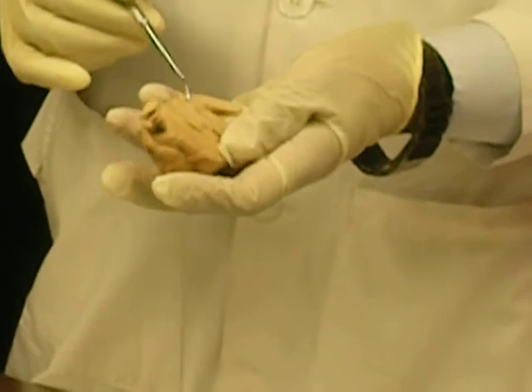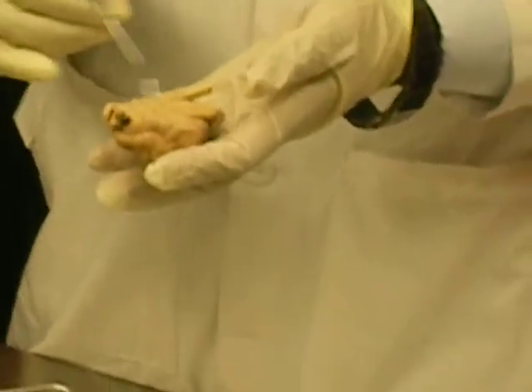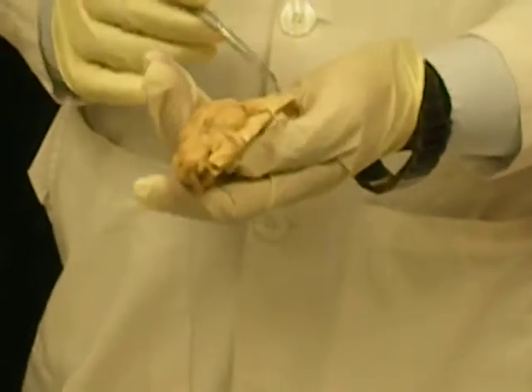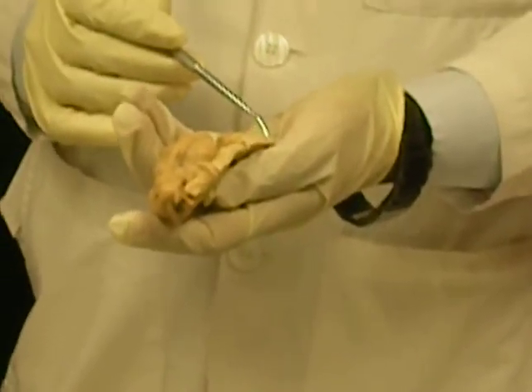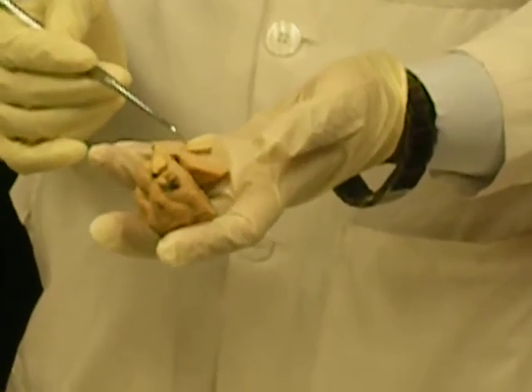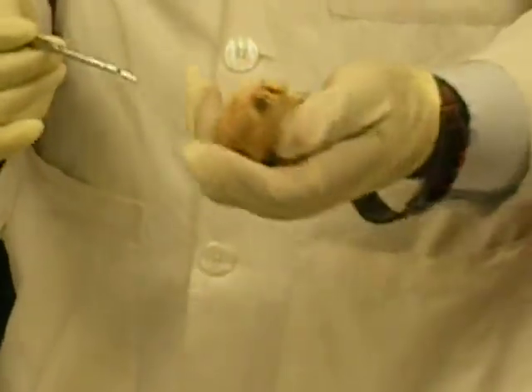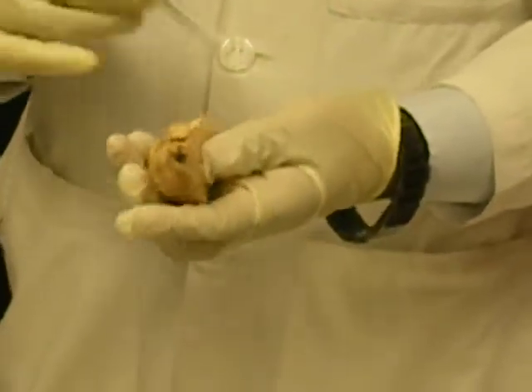And then you know that just below the midbrain region, you have got the pons, which is connected to the cerebellum, and below the pons, this part is the medulla oblongata, and just below that, the medulla oblongata continues as the spinal cord, alright? So this is all about the brain itself.